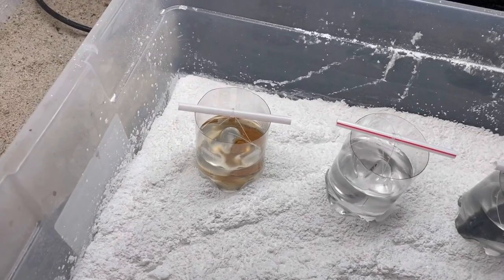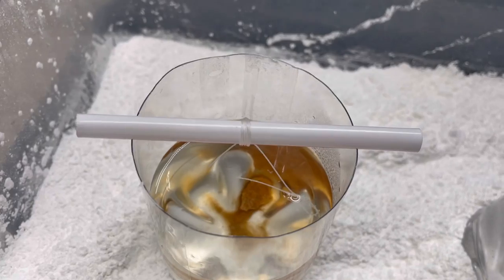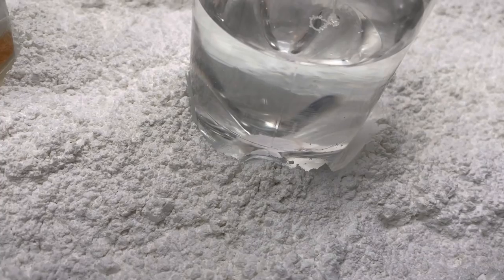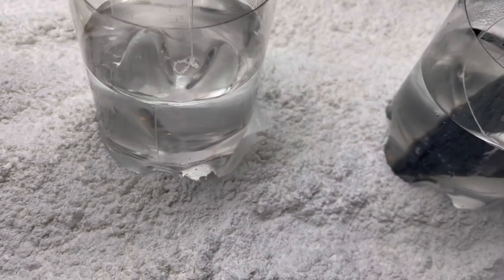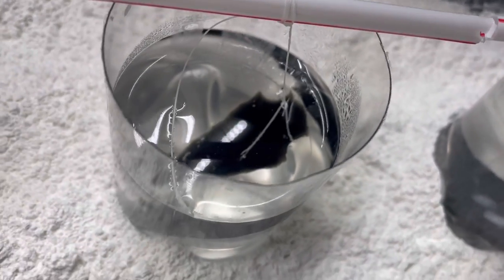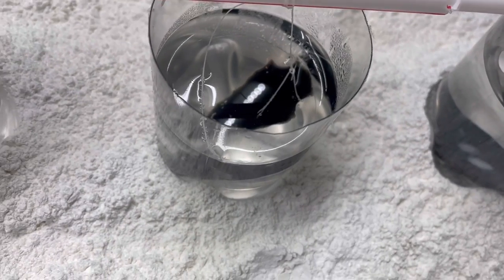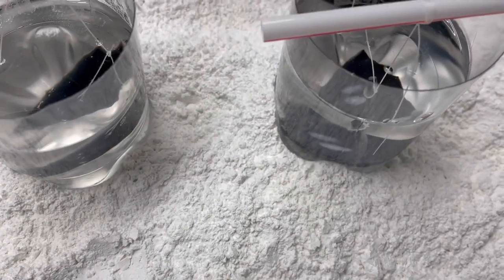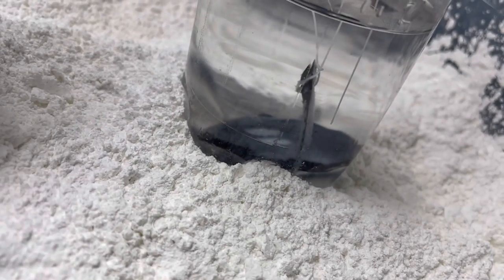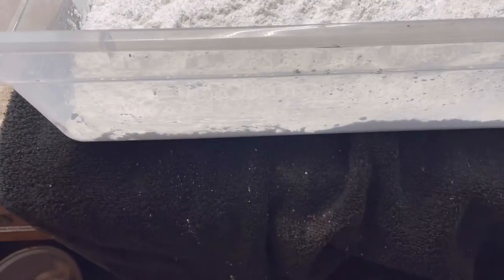So it's the next morning, about nine hours since I put them in the acid. You can see it definitely has affected them. These two especially are much dissolved. That arrowhead looks a lot rounder and smaller. That one's still hanging on though. Let's pull them out, get a better look at them.